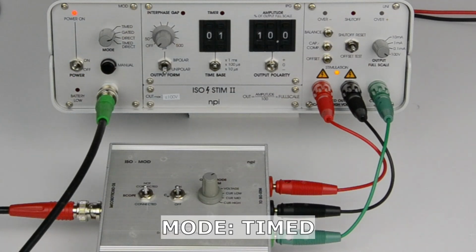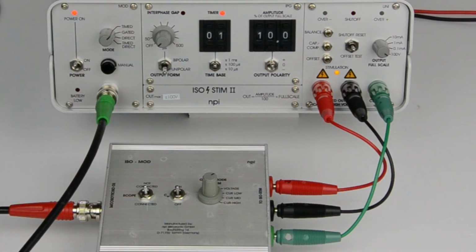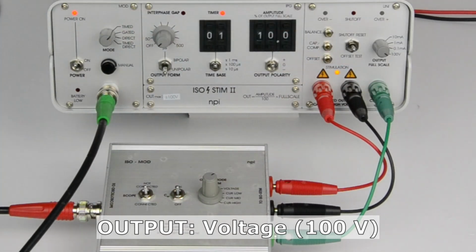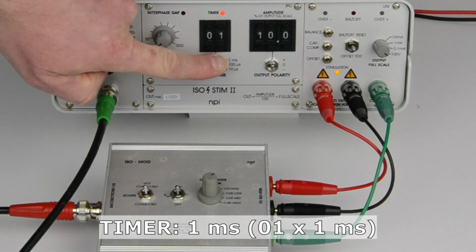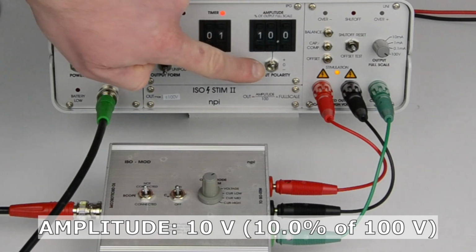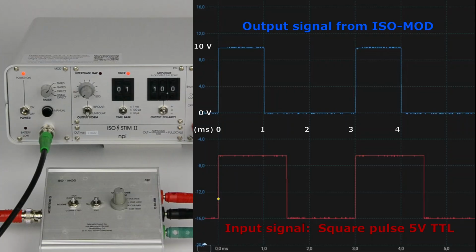To demonstrate this, we switch the ISO-STIM to timed mode, set the output to voltage, and connect the ISO-mod model cell to the outputs. The timer is set to 1 millisecond and the amplitude to 10 volts. We have an oscilloscope connected to the output of the model cell.